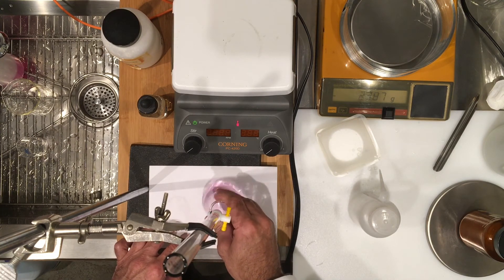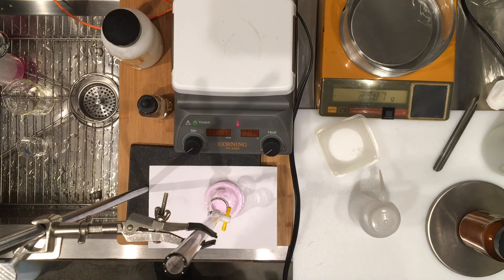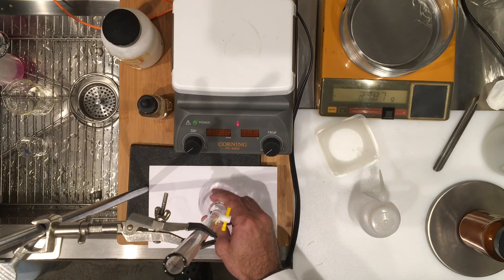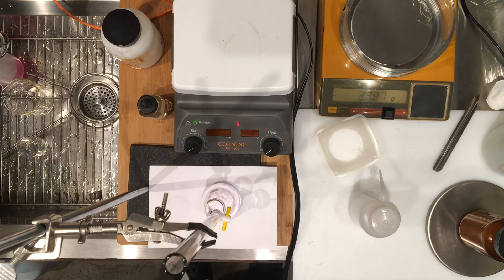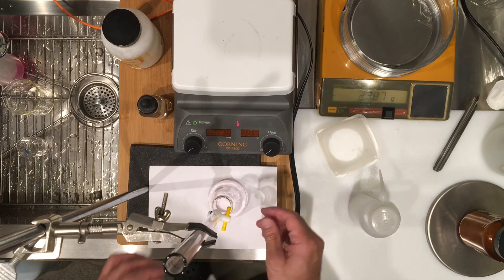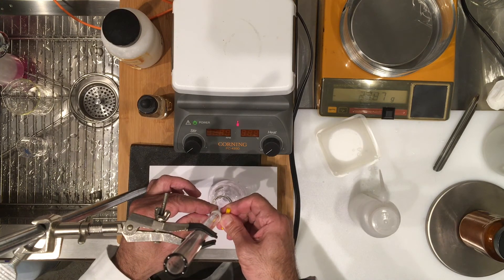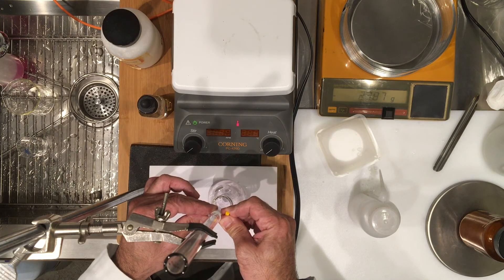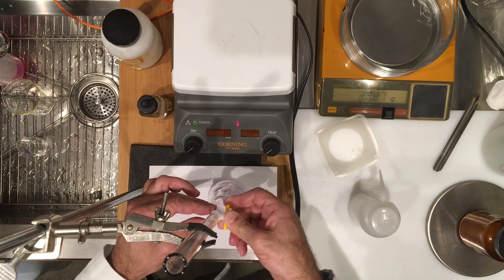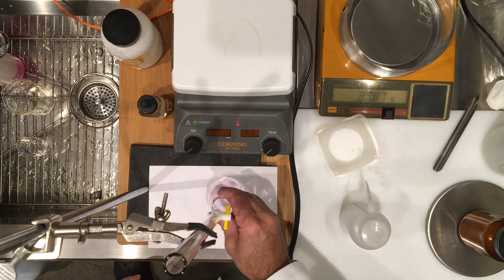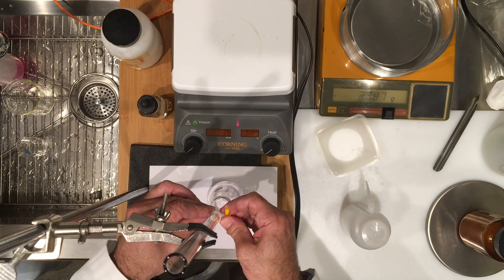Actually there was maybe a little bit of undissolved KHP, and now everything seems to be stable. I have a slight pink color, and my color is starting to go away. I can see slightly pink, which tells me that I'm really at the endpoint. But I'm going to just verify this and get maybe less than half a drop. I'm just going to wash that in and see where I am. I didn't do it.